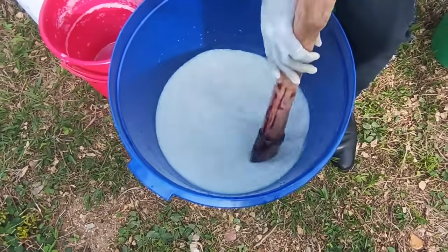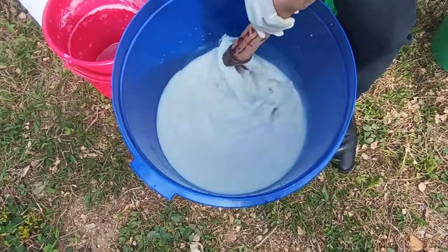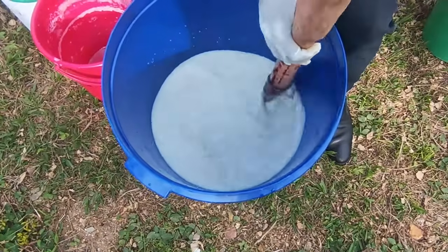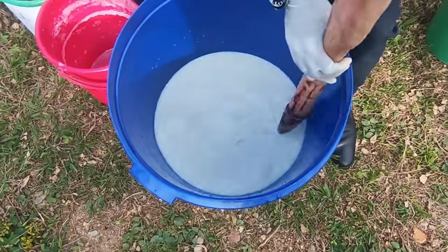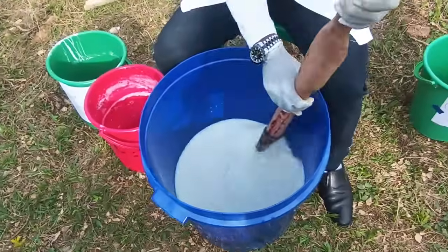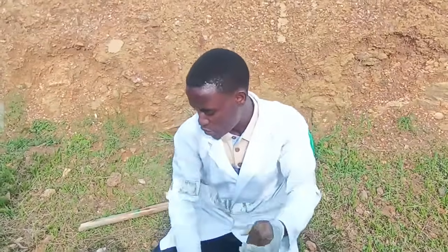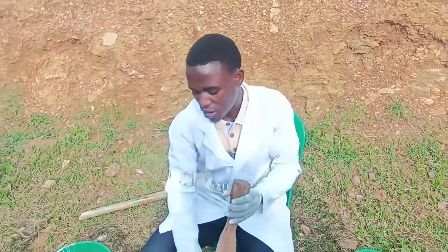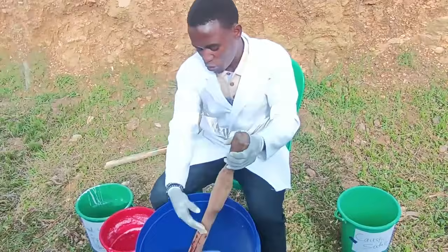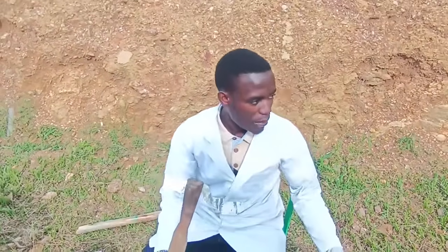We had already 15 liters, which means we are just going to top up the remaining volume to make our 20 liters. We said you can dilute this to 30 liters depending on what you want. But for us, we are going to make the one for 20 liters. Since we already have these 15 liters, we are just going to add 5 more liters.